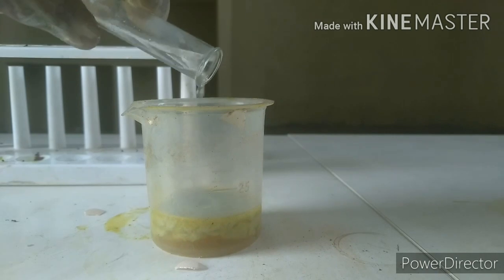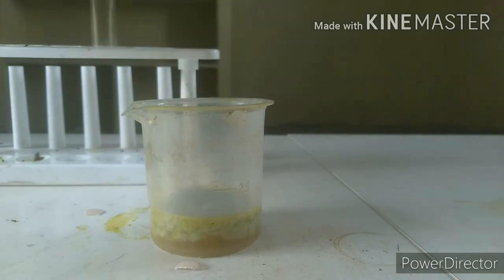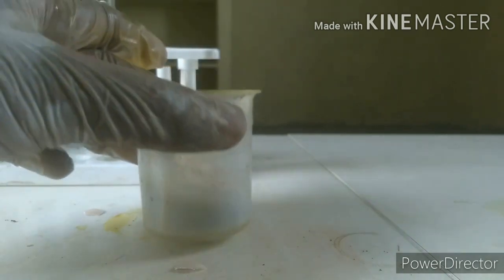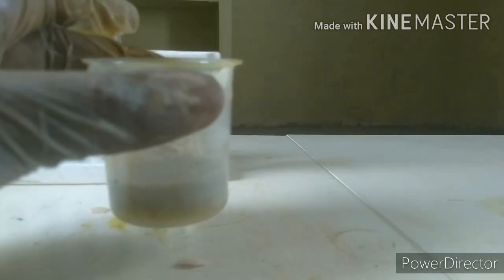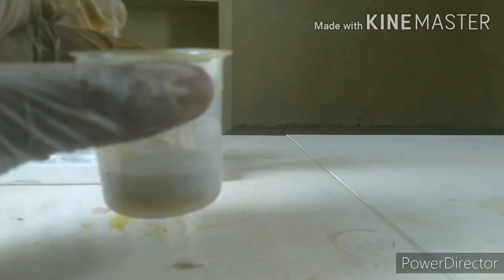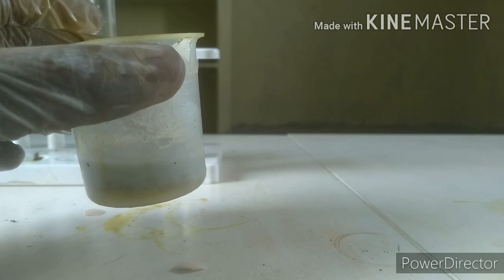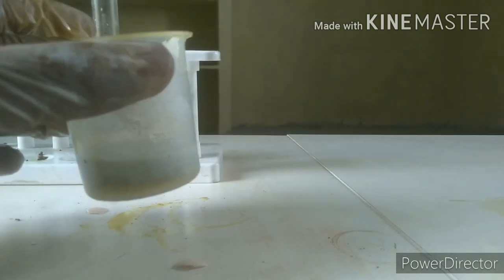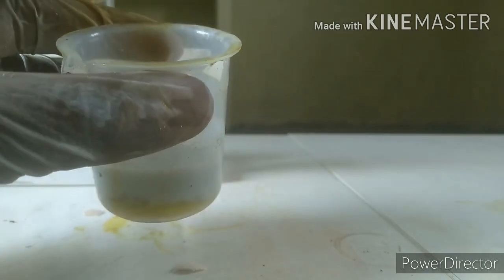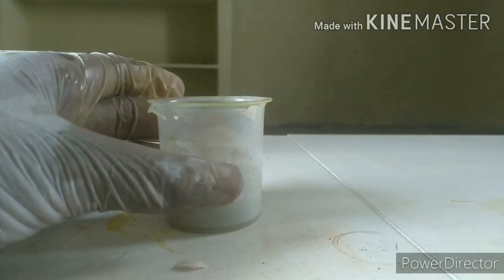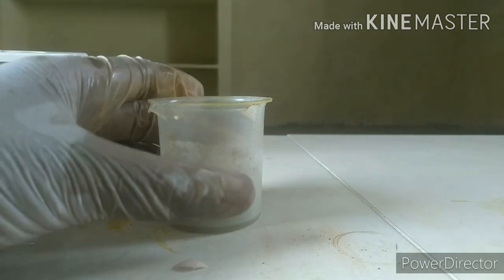Here we go, white precipitate showing calcium hydroxide. You can simply add some water and dissolve all that sodium chloride. Because calcium hydroxide is insoluble in water you can get that sodium chloride filtered and get this calcium hydroxide. This calcium hydroxide is used in making bleaching powder and also in other industrial applications.